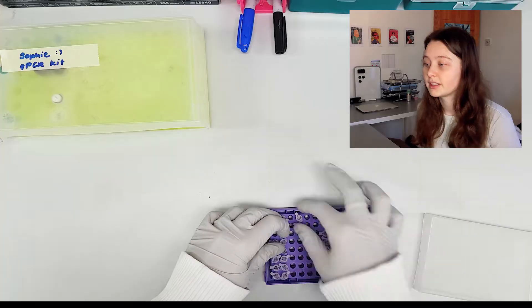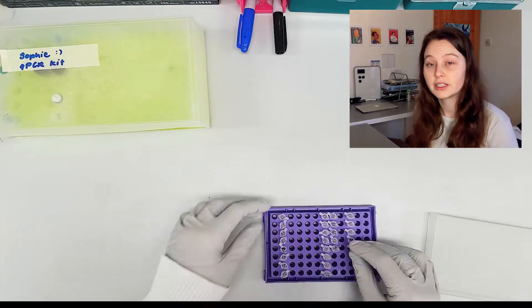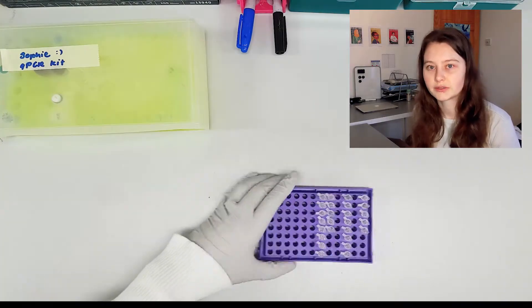So the first thing I'm doing is ordering my samples. In this particular test I was looking at samples from three different locations, so I'm just pulling them apart to make sure I have every sample I want from each of those locations.